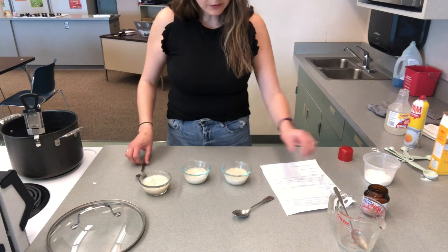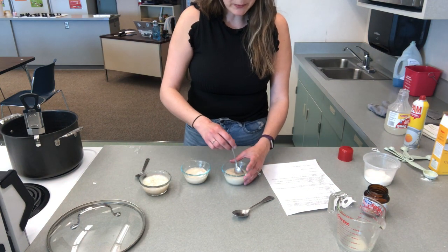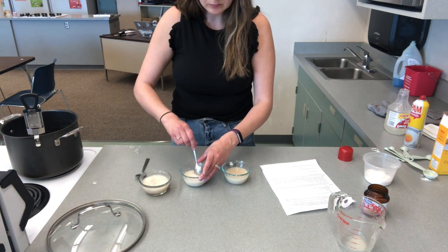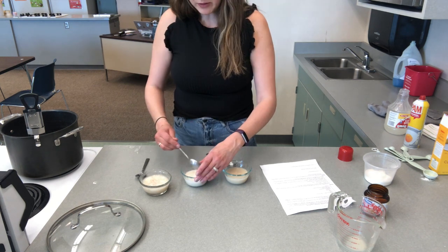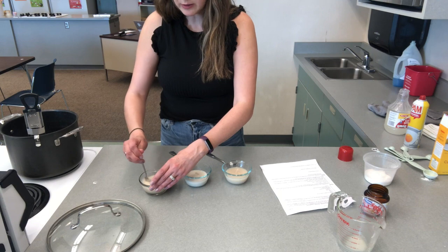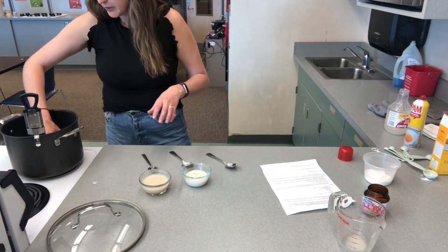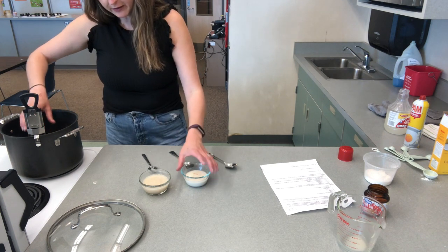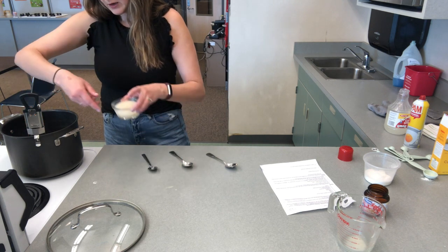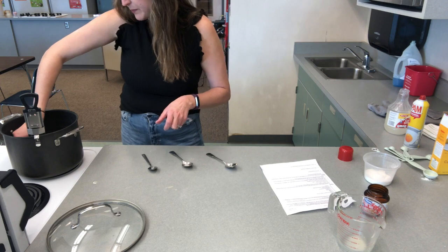And I'm going to measure out those 3 and then just stir them up until they start to dissolve. Just use each spoon separately. Put them in, just be really careful into this water bath so they don't spill into your water. And keep track. You want to keep track of your 3 ingredients. So I've got sugar on the top left, cornstarch in the bottom, and corn syrup on the right-hand top side.